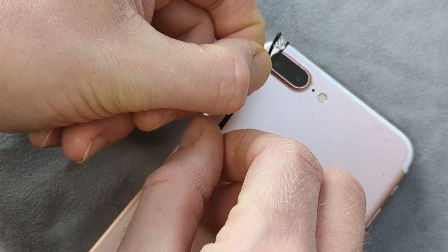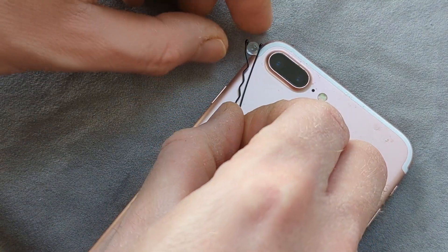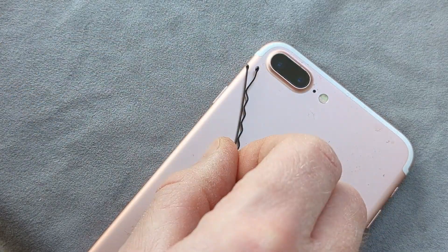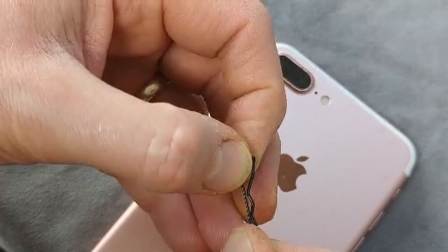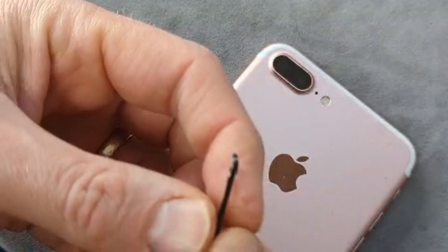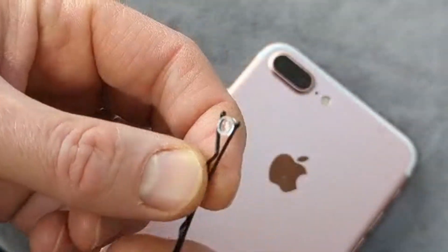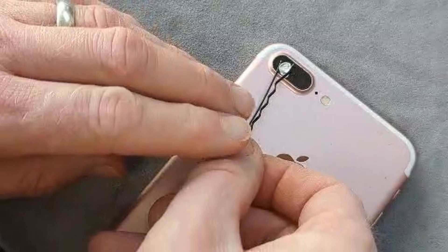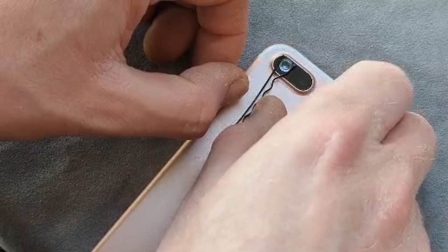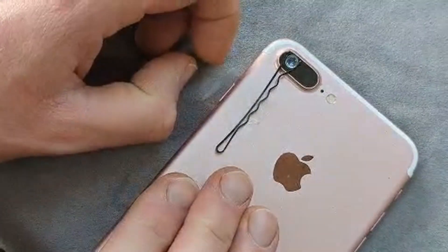You can see it's taken at least three attempts. What I haven't shown you is picking it up off the floor as well. It's a tiny little thing to find when you've got two dogs chasing around at your feet. It's not the easiest thing to do in an unpressured, calm and collected way. But eventually, I actually got there.